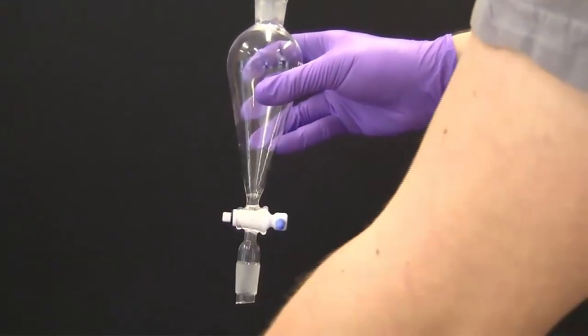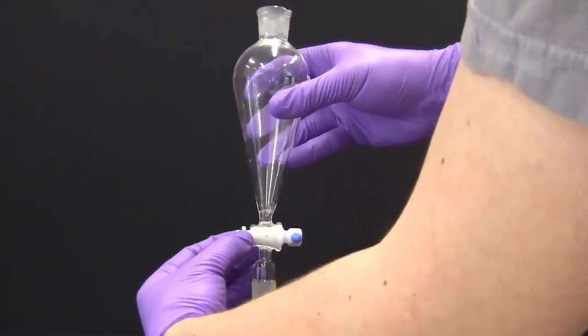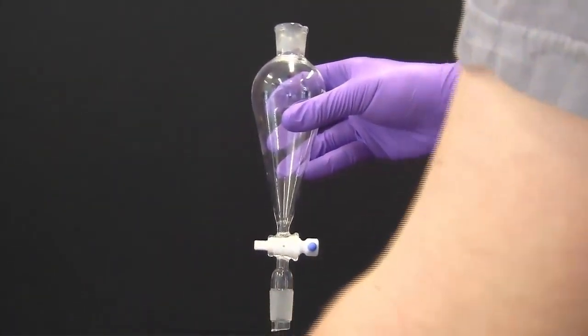You need to clean the stopcock before and after each use. When not in use leave it assembled and cleaned but very loose fitting. The plastic will distort if it is kept tightly in the funnel.